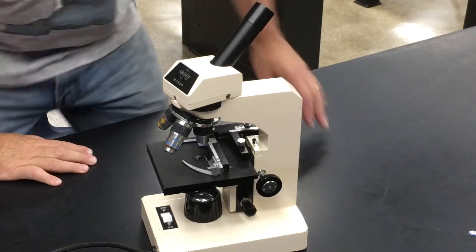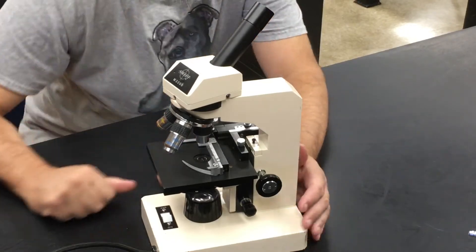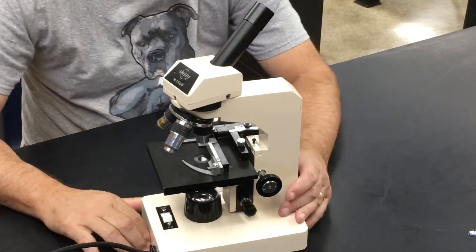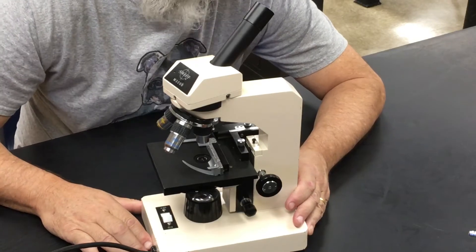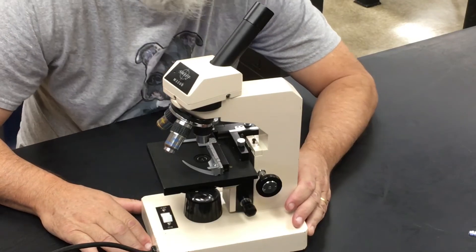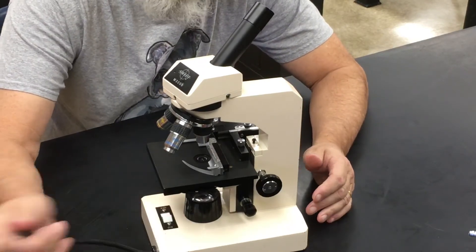Okay, hello everyone. I'm going to go over the microscope with you right now. These are the parts of the microscope and what they do, so you should be familiar with these. We're going to start out with the basics.